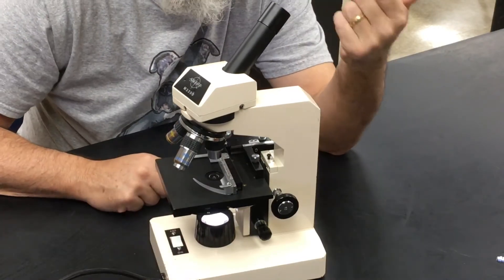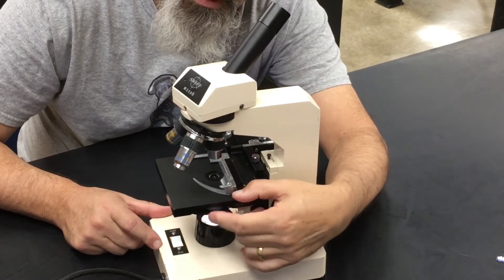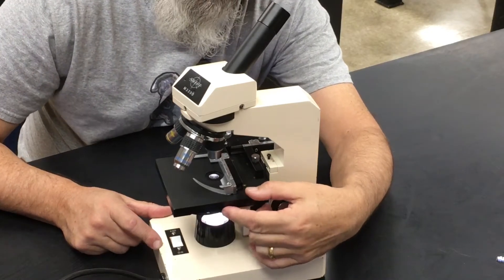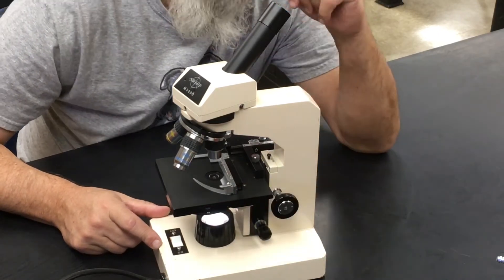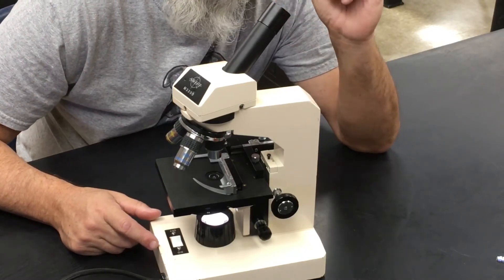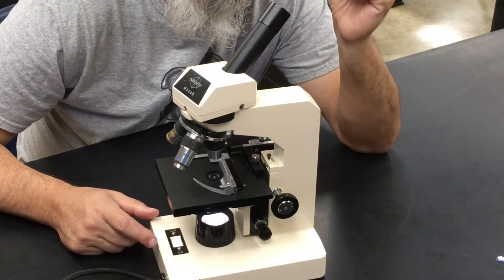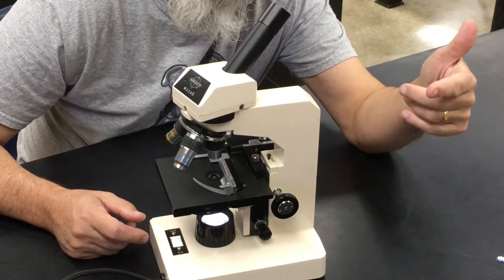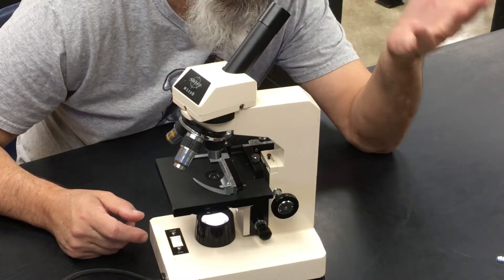You can control the light with this little dial on the side of the stage called the diaphragm. There are little numbers that go from one to five — five is the brightest setting. You can adjust the amount of light with the diaphragm. If you've got something that's really transparent, like a dragonfly wing or small microscopic plants called diatoms or algae, one-celled organisms — if they're pretty transparent and you turn the light all the way up, the light will become so bright you won't be able to see them.